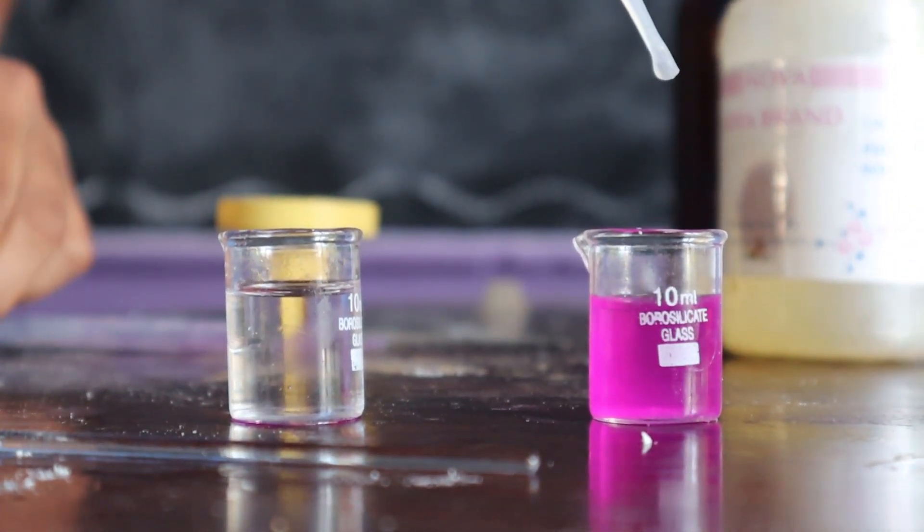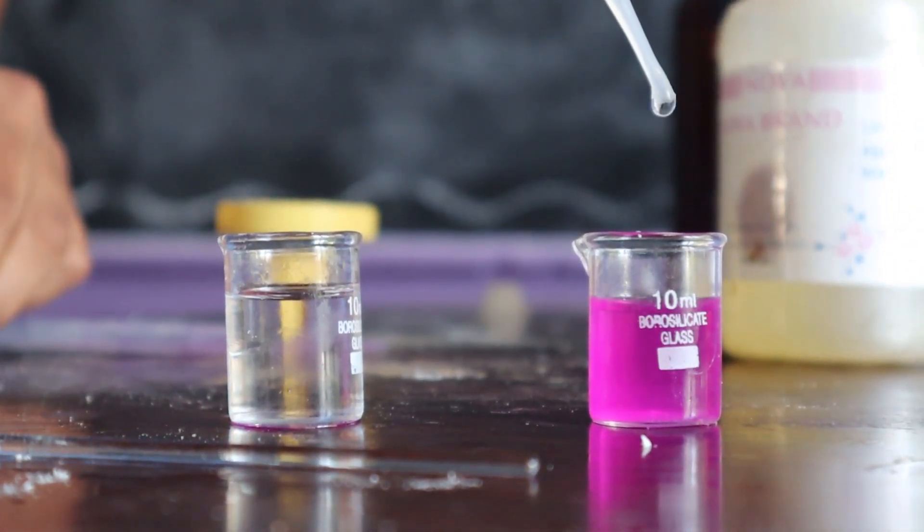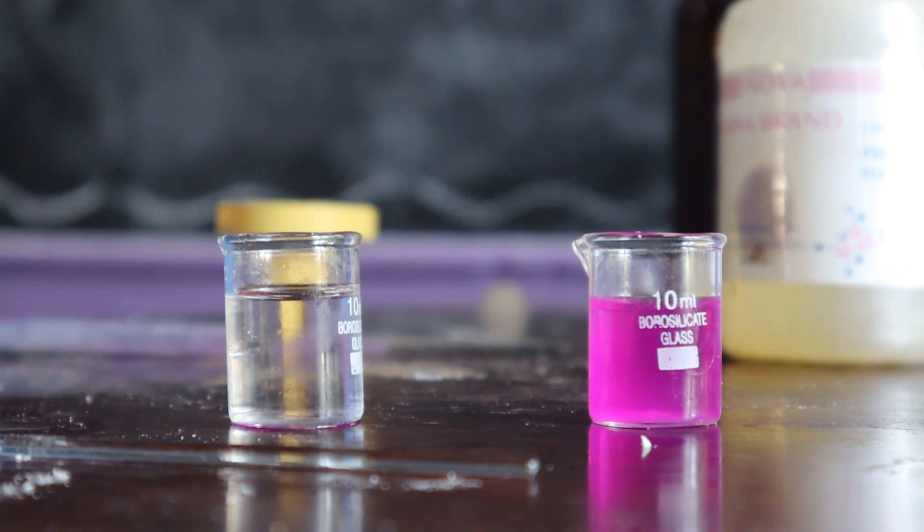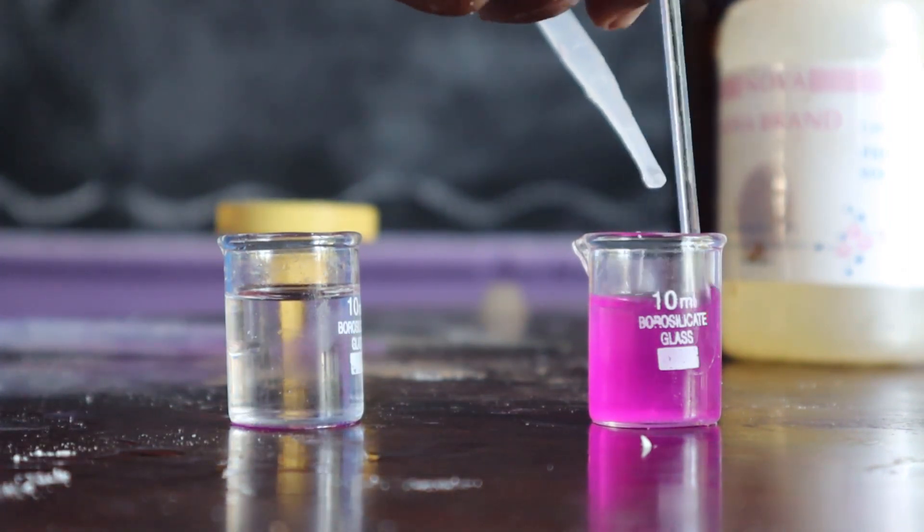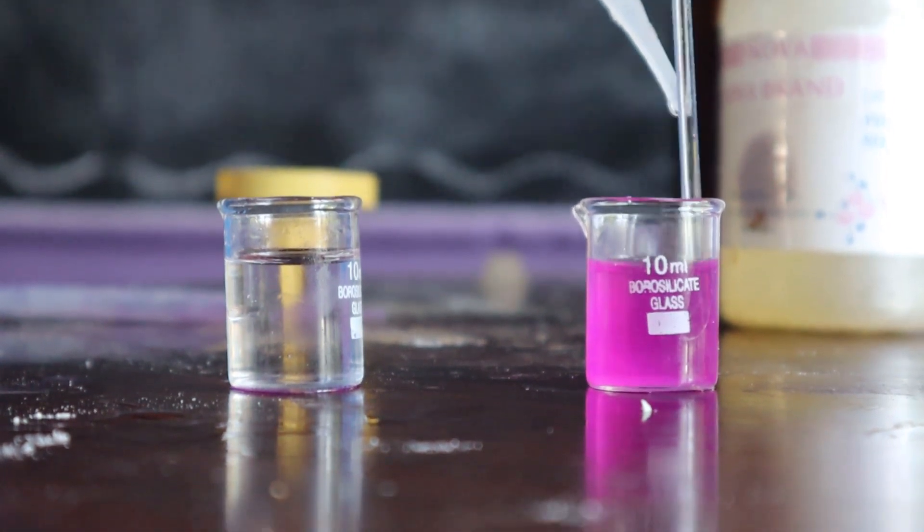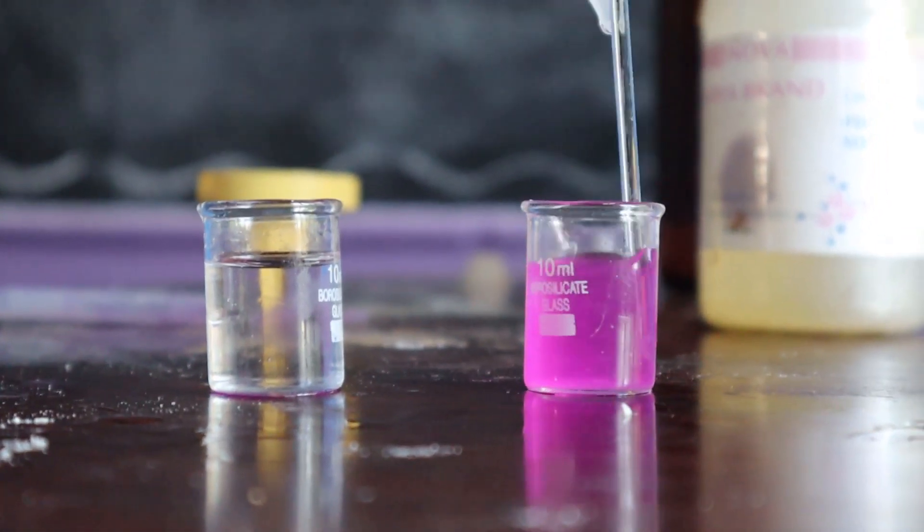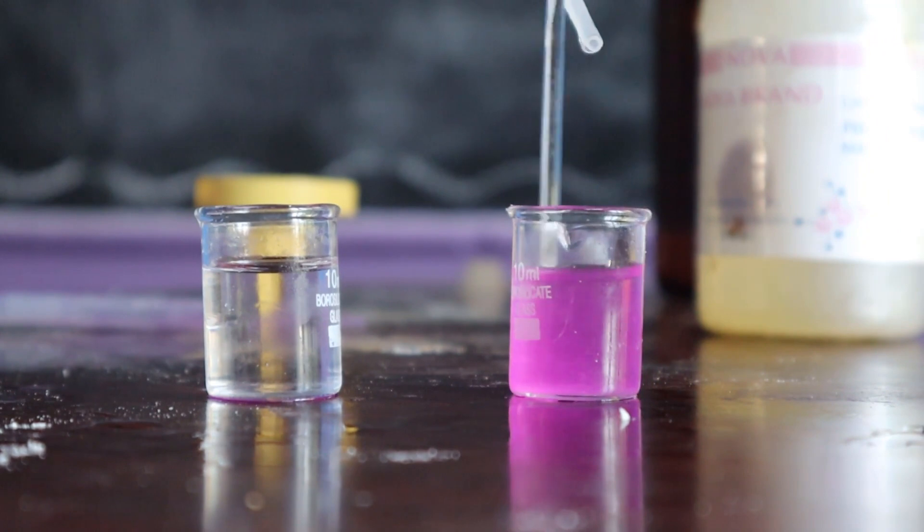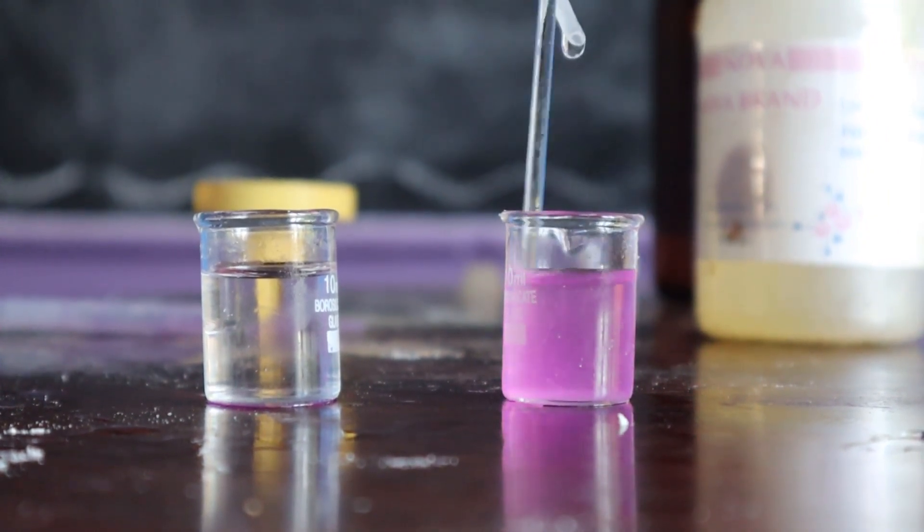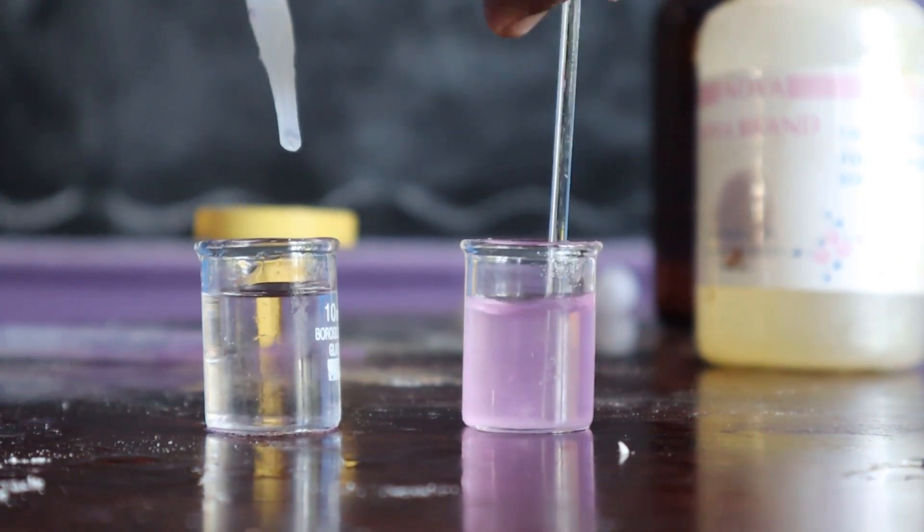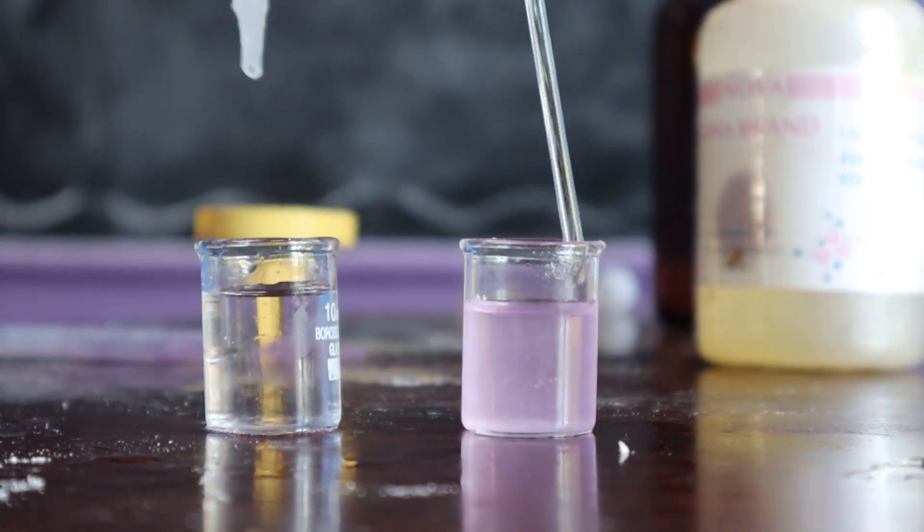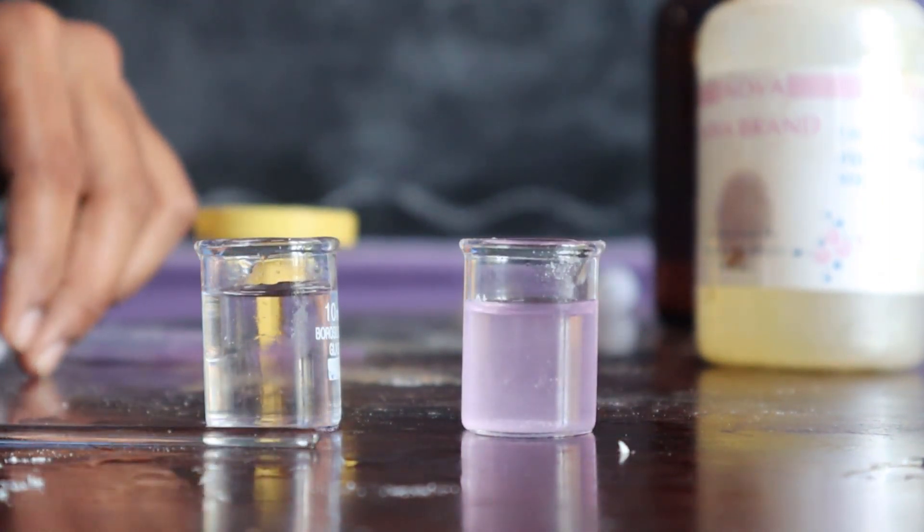If we add acid solution to the base solution dropwise, it turns colorless. Now this is a neutral solution.